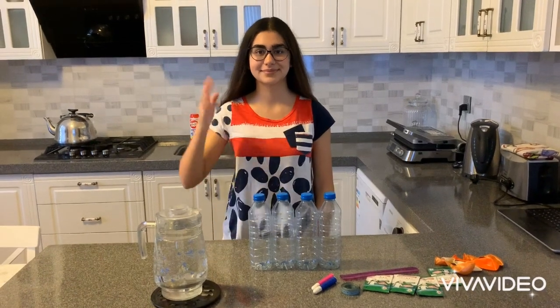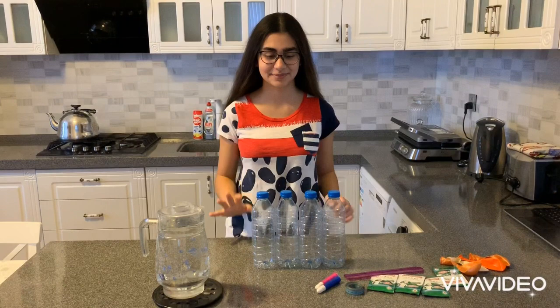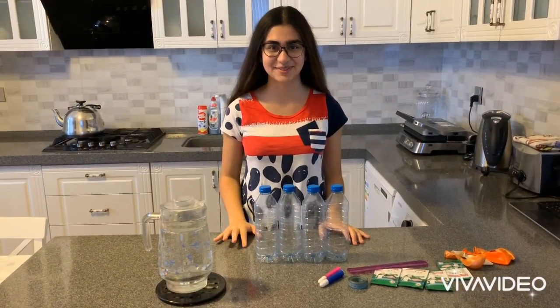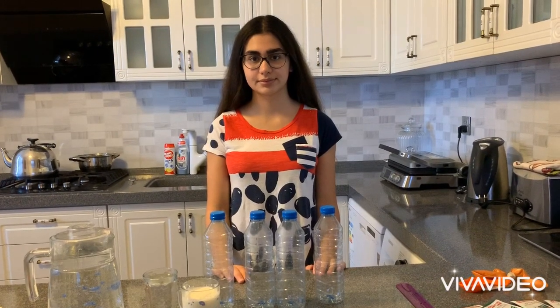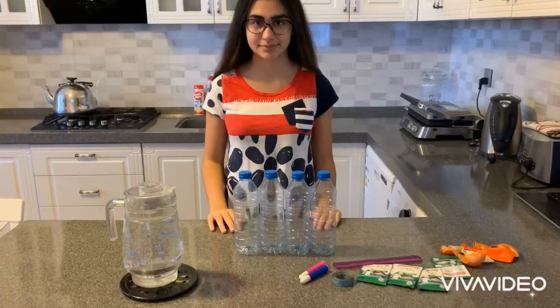Hello everyone! Yeast is affected by a number of factors, and in this experiment we will determine which factors affect the activity and growth of the yeast. The main goal is to observe the growth of yeast in different solvents and places in the fermentation process. At the end of the experiment, I will be able to answer these questions.